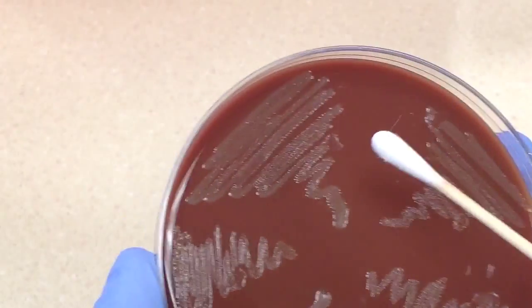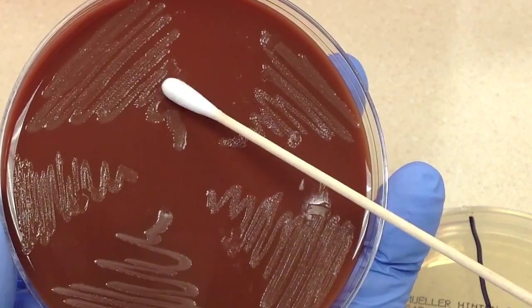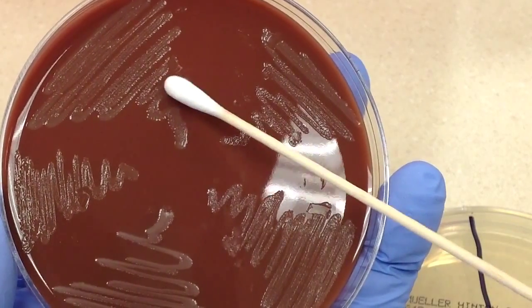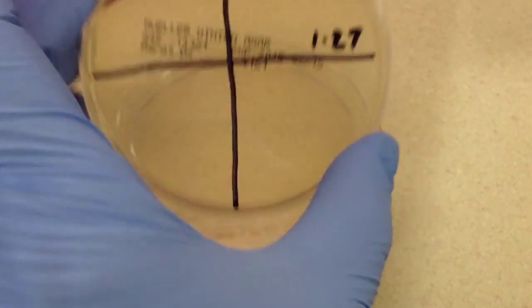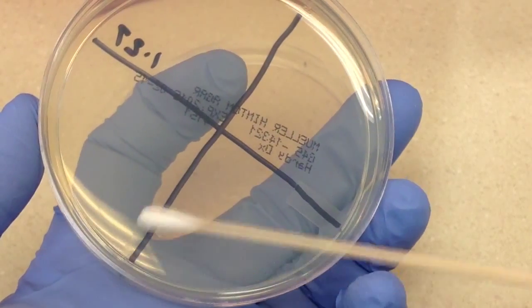Okay, I'll just take a little bit off my plate here. Okay, now it's important that I get the organism spread over the complete face of the plate.